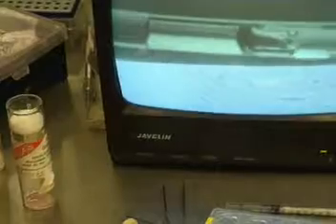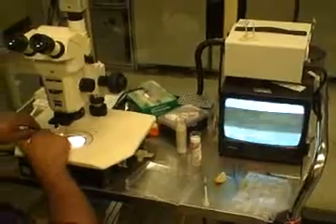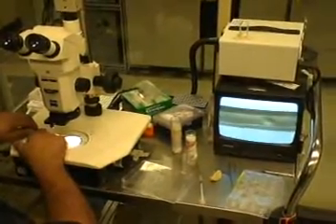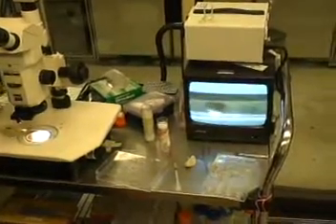That's a nice looking crystal. I'm drying the column of water now — it's completely dry. Now the crystal is sitting in a little meniscus right there. I'm going to rotate it and zoom in. Now the capillary is ready to be sealed.